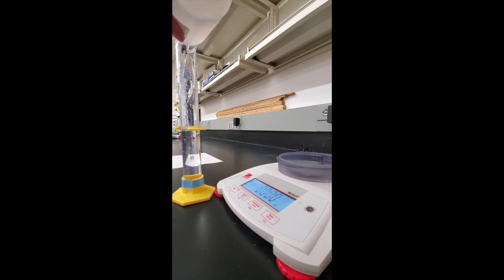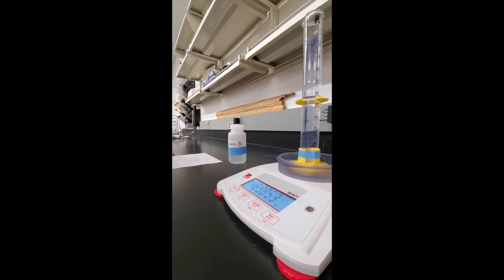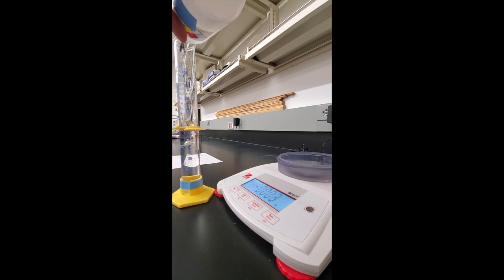The third measurement takes us up to a volume of 59.9 milliliters. The mass is 169.853 grams.